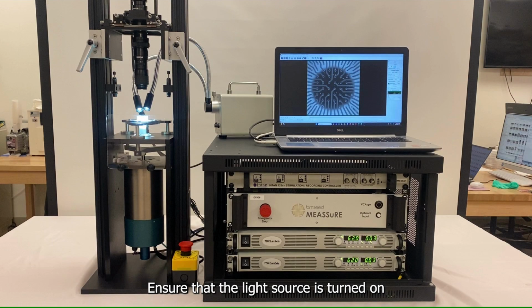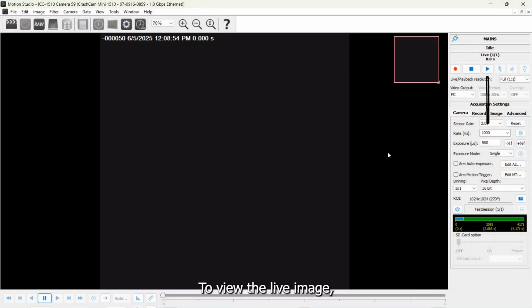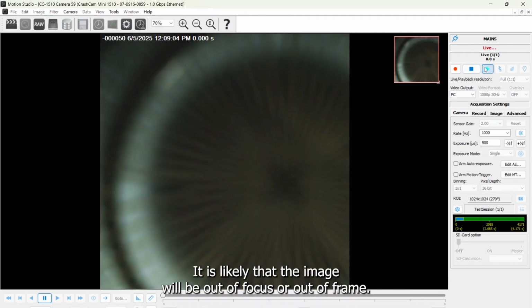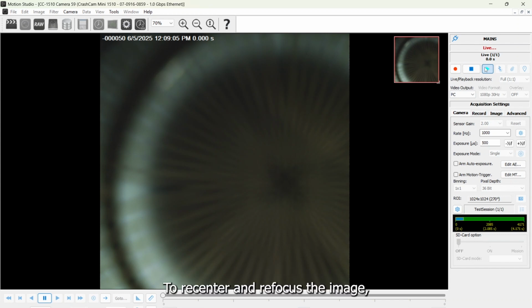Ensure that the light source is turned on and positioned toward the sample. To view the live image, select the Live button. It is likely that the image will be out of focus or out of frame. To recenter and refocus the image, we will need to adjust the camera.